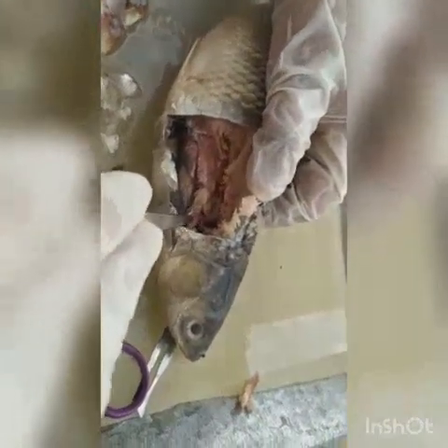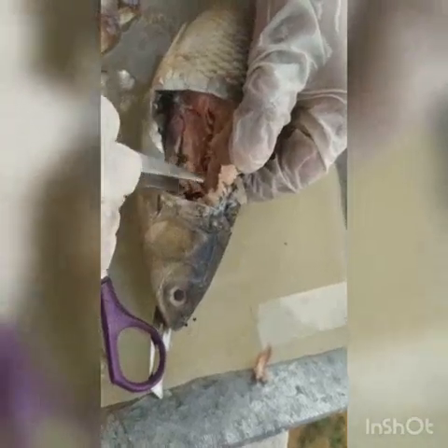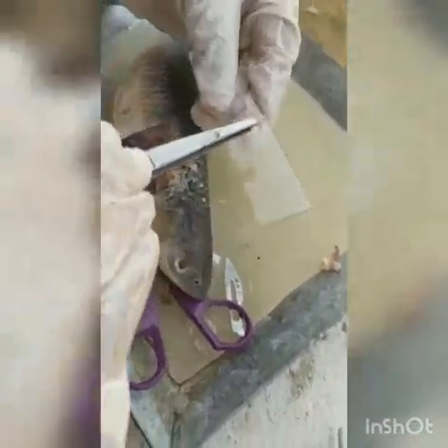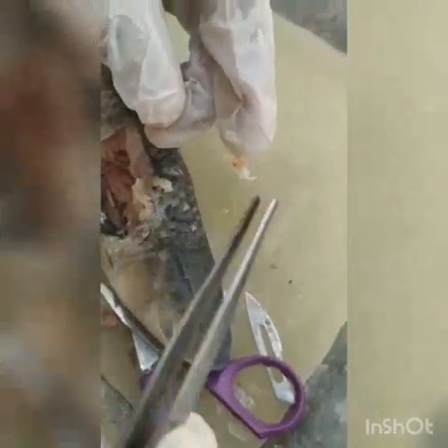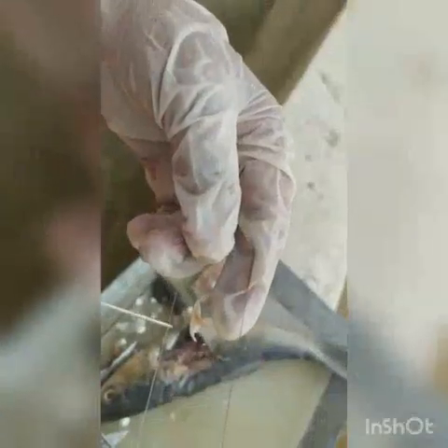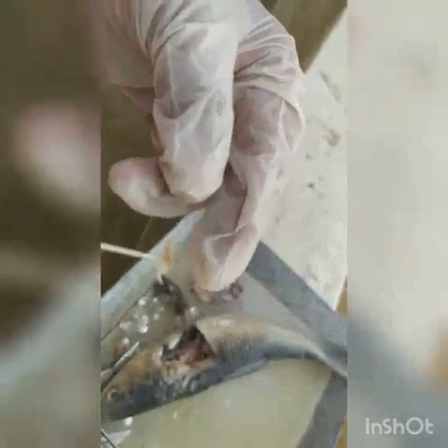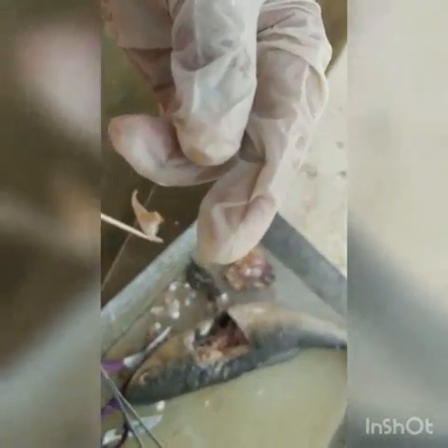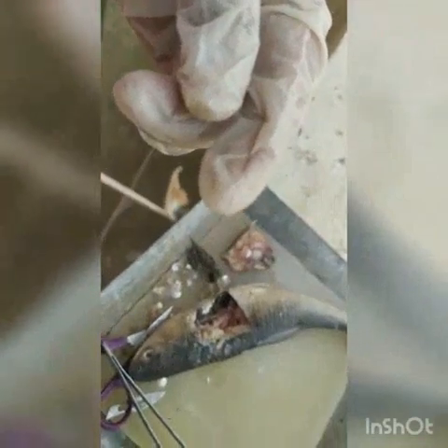Here we have found the Weberian ossicles, and next we have to mount it. This is our dissection, and here we can see the Weberian ossicles. Let me explain the different parts of this Weberian ossicle in detail. Here we can find the articulating process — this one is the articulating process — and you can see the projections here, the processes.